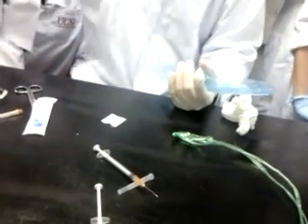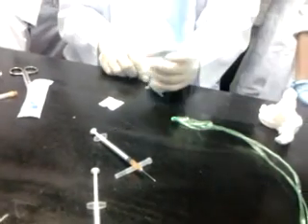Minimal bleeding is okay, not maximum bleeding. You can see the animal is a bit drowsy. The dose is not enough because we are leaking out. The skin becomes very weak. So we have two veins, one on the left side and one on the right side of the lateral vein, so you have ample veins to do it.